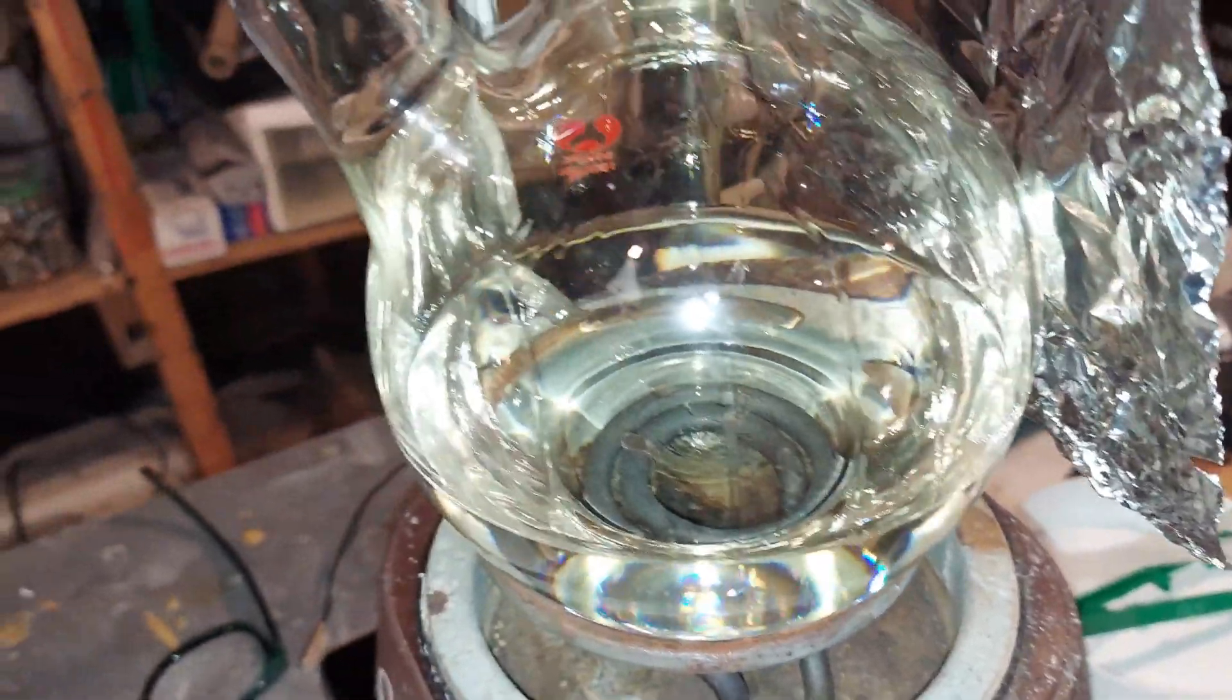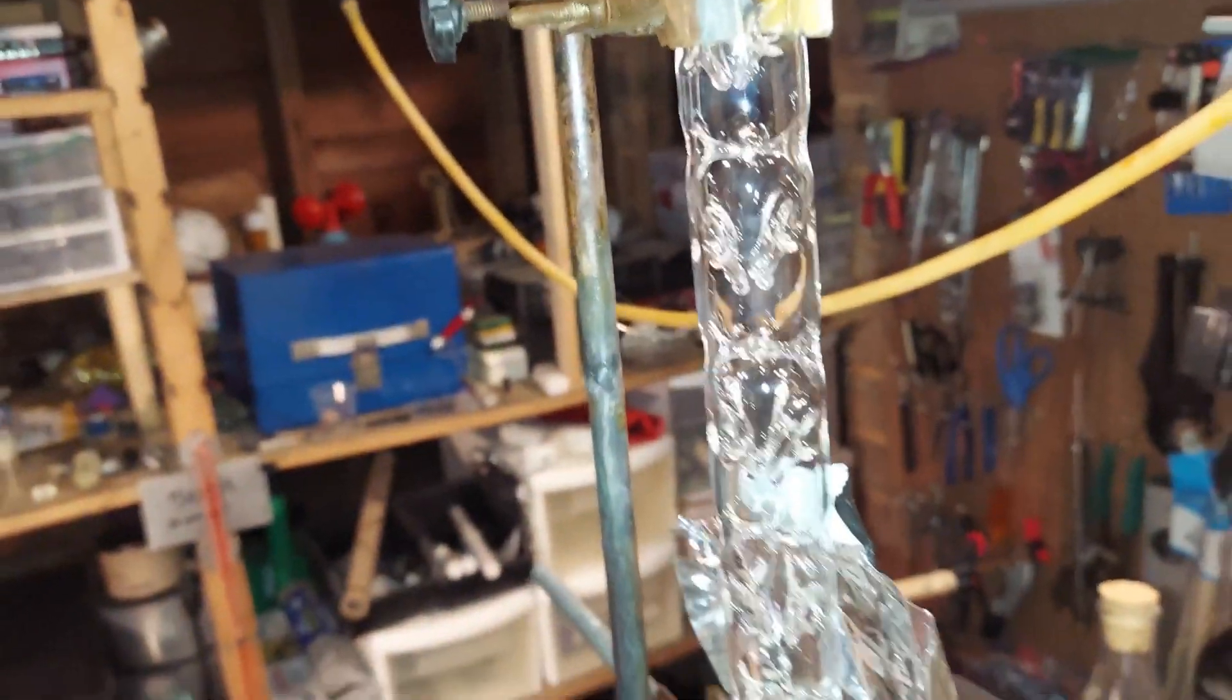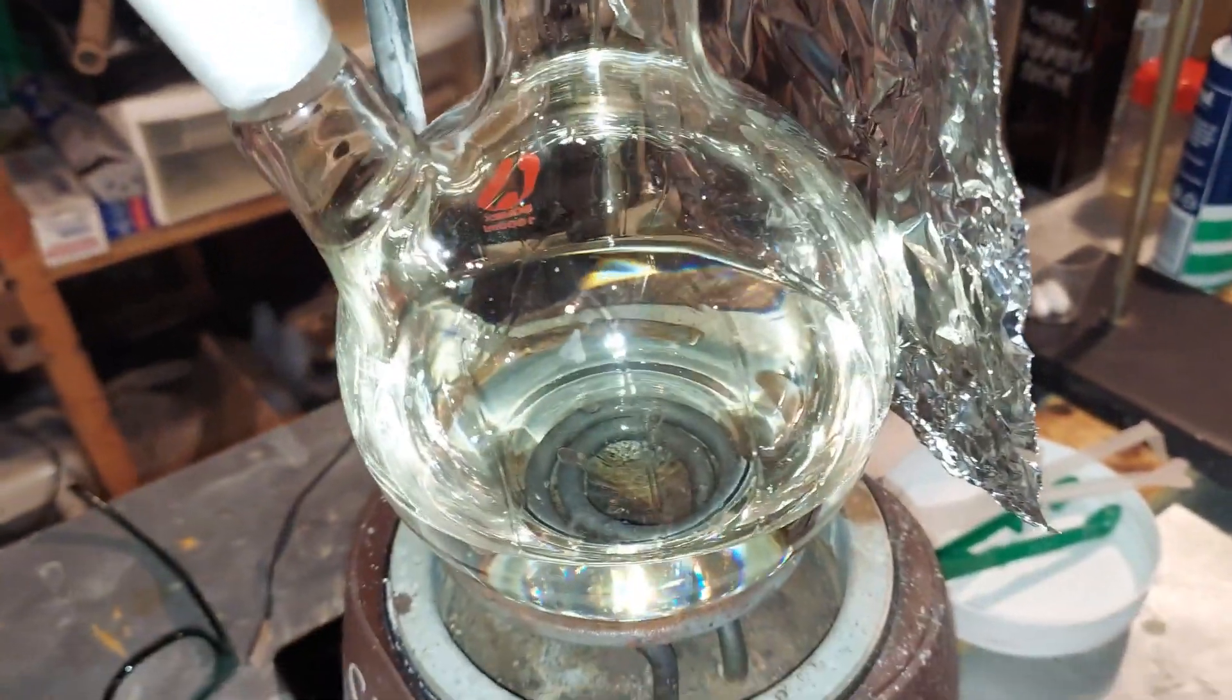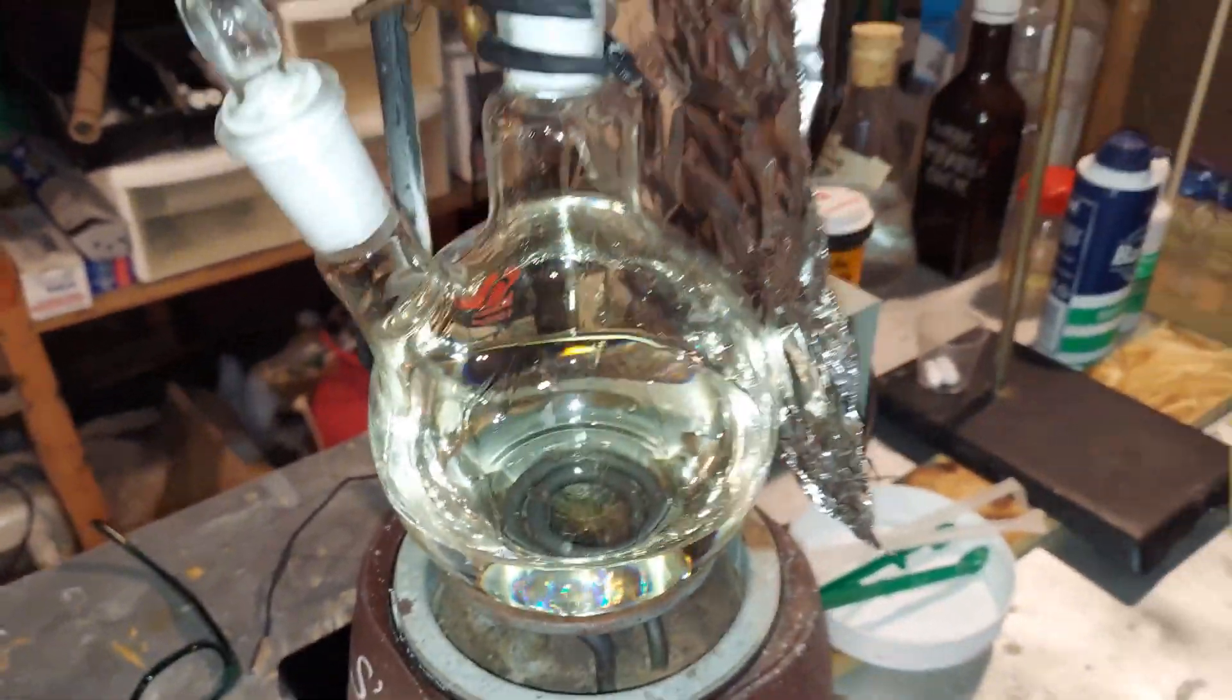It's all the same, and to run it through the fractional distillation one more time didn't make any sense because heat destroys some nitric acid. So I stopped.